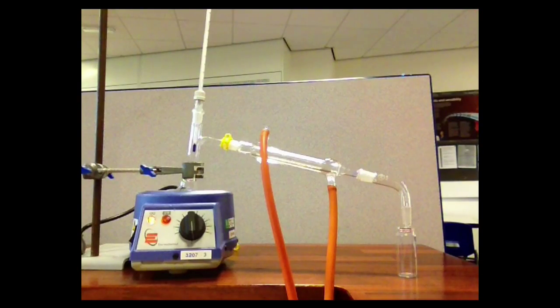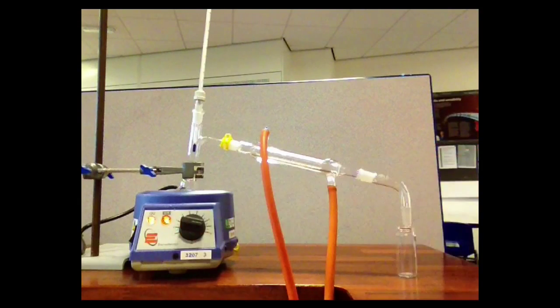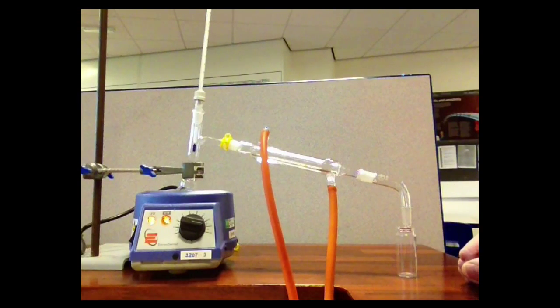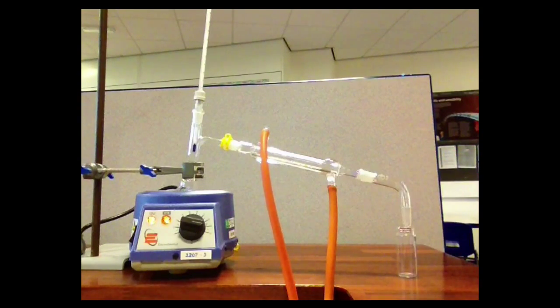All that remains then is to turn on the heater, initially to a fairly high heat, and wait for the mixture in the flask to start boiling. When you're carrying out distillation, you'll always stay with the equipment, watching it carefully, adjusting the intensity of the heating to ensure a nice smooth boil, and watching the thermometer in order to check the boiling point of the liquid being collected.